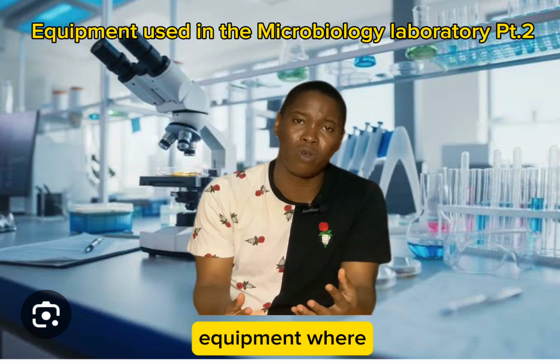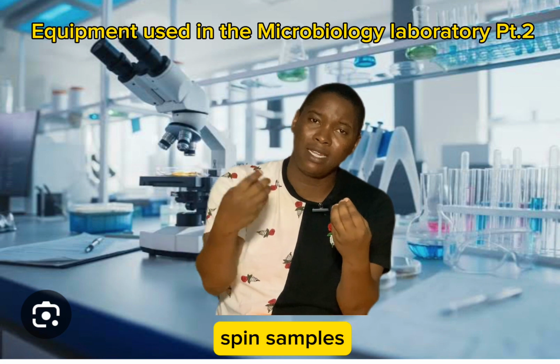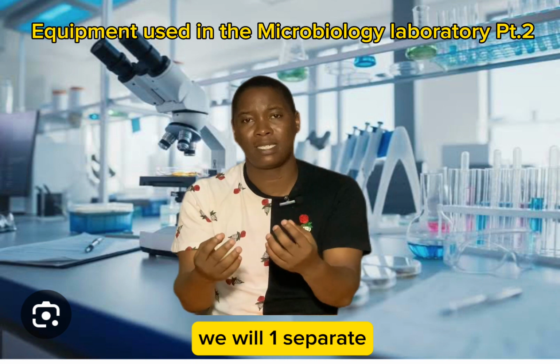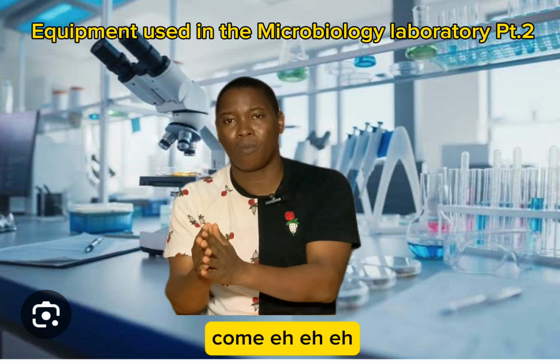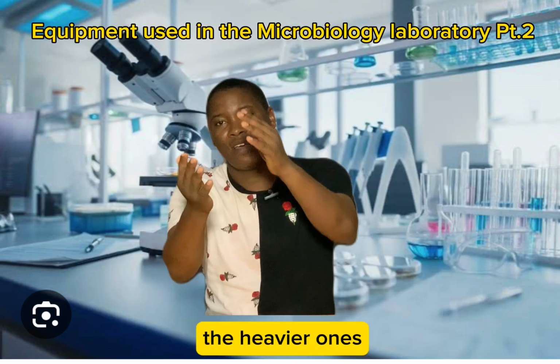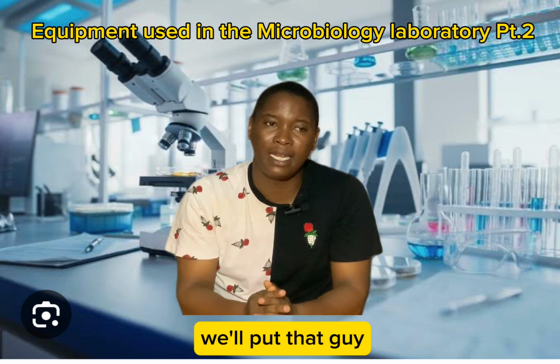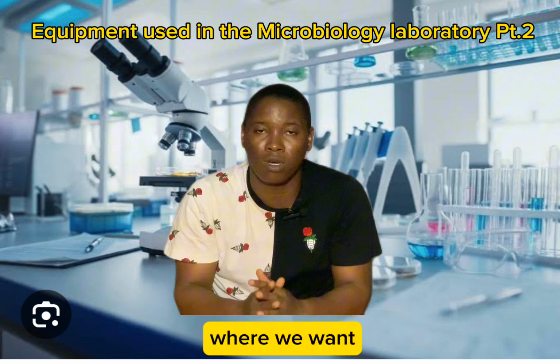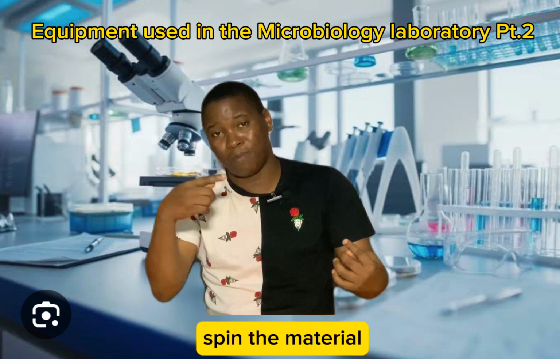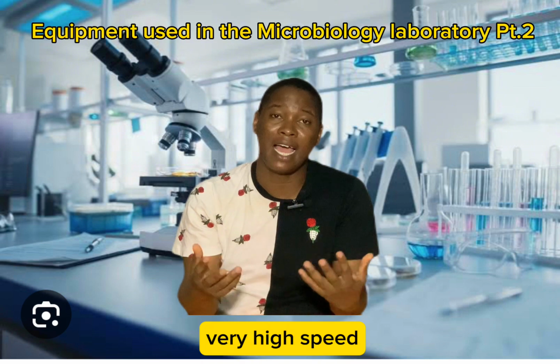The next one na centrifuge. Centrifuge na equipment wey we dey use for laboratory, wey be say we dey use am spin samples, any material or sample wey we get, wey we wan separate that material or sample into its component part, meaning say the heavier ones go dey down, the lighter ones go dey up. We'll put that kind sample wey we wan separate inside centrifuge. That centrifuge go come spin the material at a very high rate, very high speed.